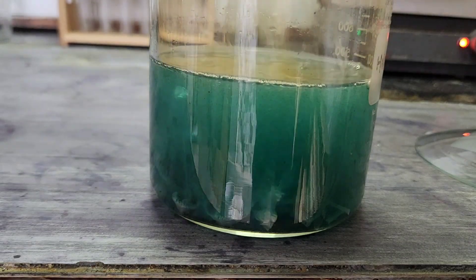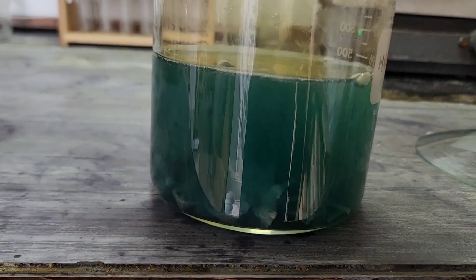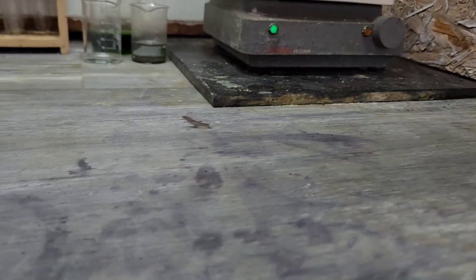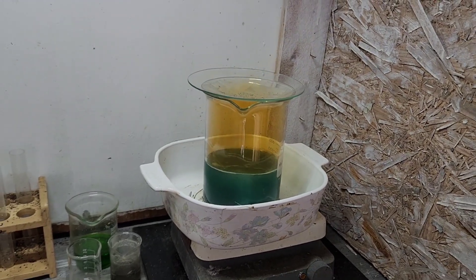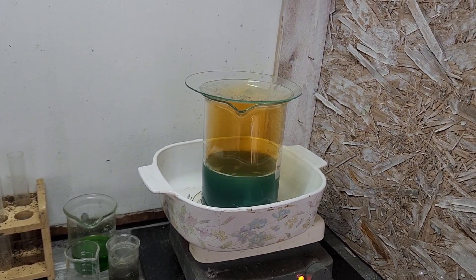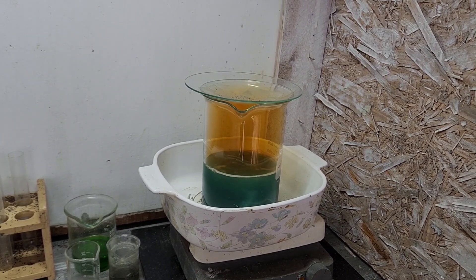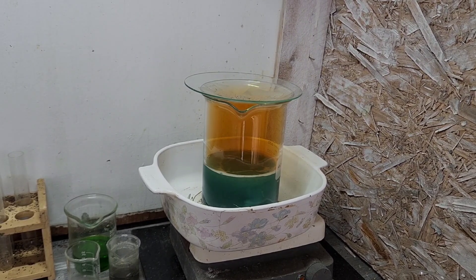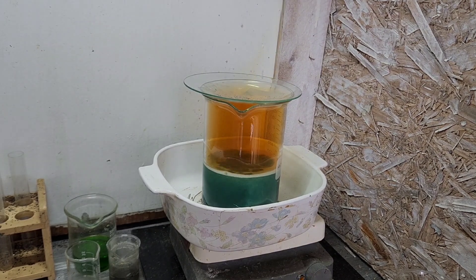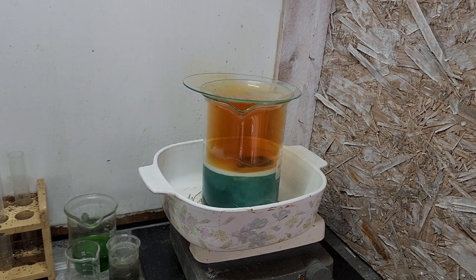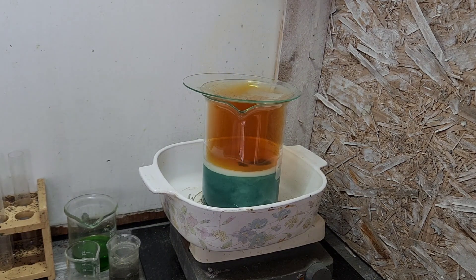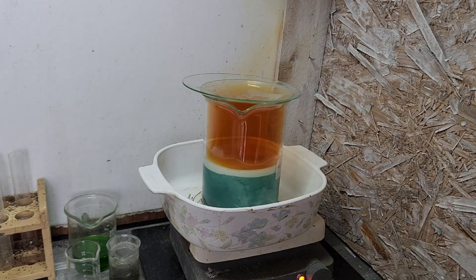All right, I think we're cooking with fire now. All right, got good reaction going on again. I'm just gonna stand here and watch this for a minute just to verify we don't see anything take off. Keep my glove on and the trusty squirt bottle just in case. But we should be okay. It's pretty well diluted at this point.